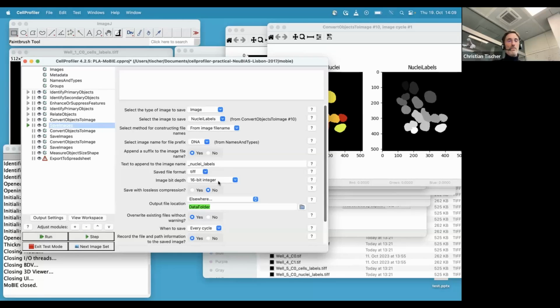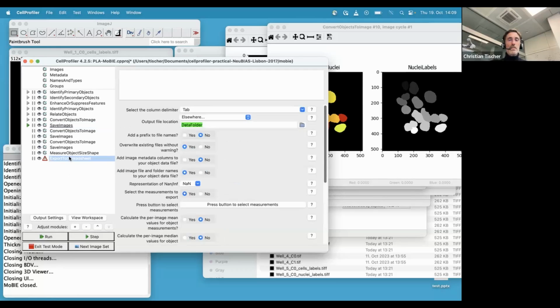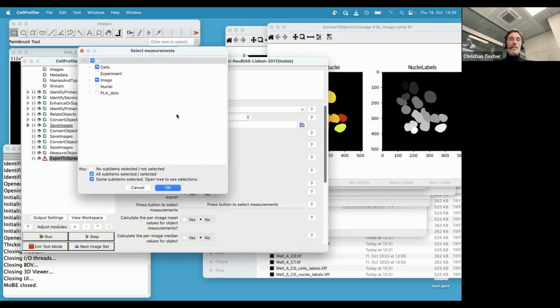So this is maybe again something that you might not always do when you use CellProfiler, but I actually think it's anyway good practice because this is a very standard way of saving the segmentations. Okay, so this is critical. The other thing that is critical, that in the table that you save, there are 2 things you need to do if you want to be compatible with MoBIE.